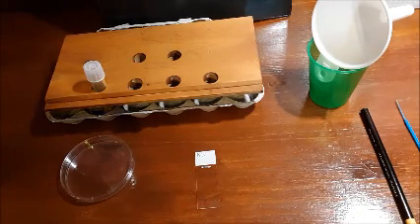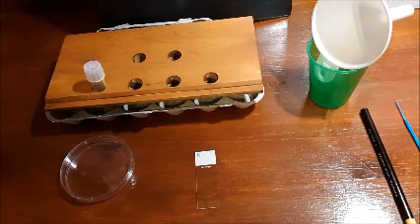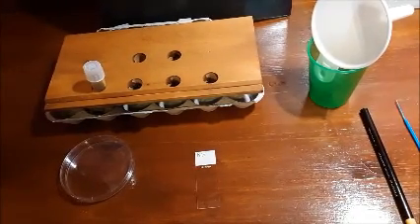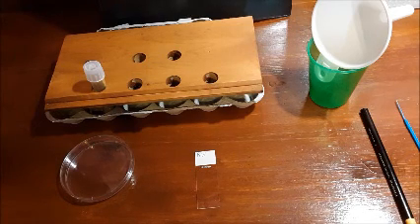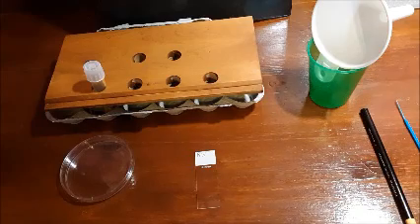After you've put your culture in the incubator, you have to disinfect yourself and your workspace. You would first move all the materials out of the way. You would disinfect it with germicide. And then use paper towels to wipe the surface down and also to dry off your workspace. Then throw away any of the used paper towels in the biohazardous waste container. Once you've done that, remove your gloves and put them in the biohazardous waste container as well. Then go wash your hands thoroughly.